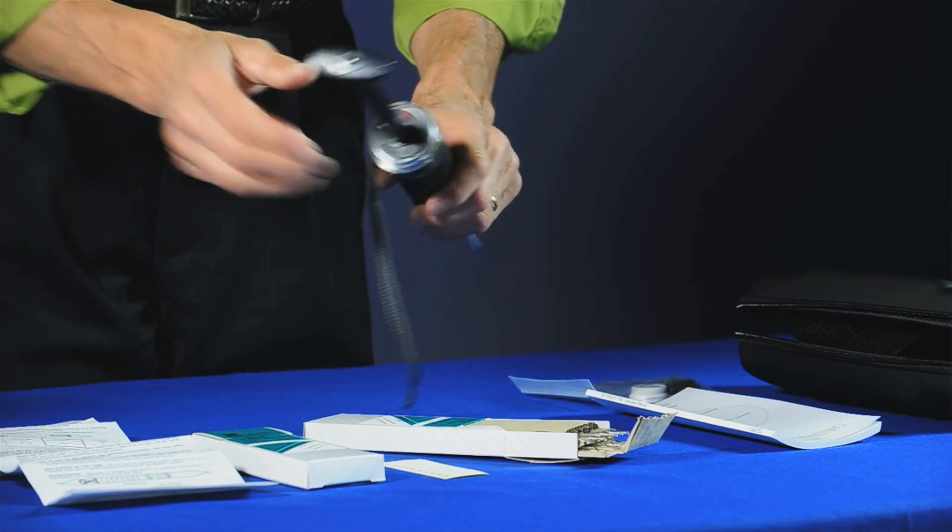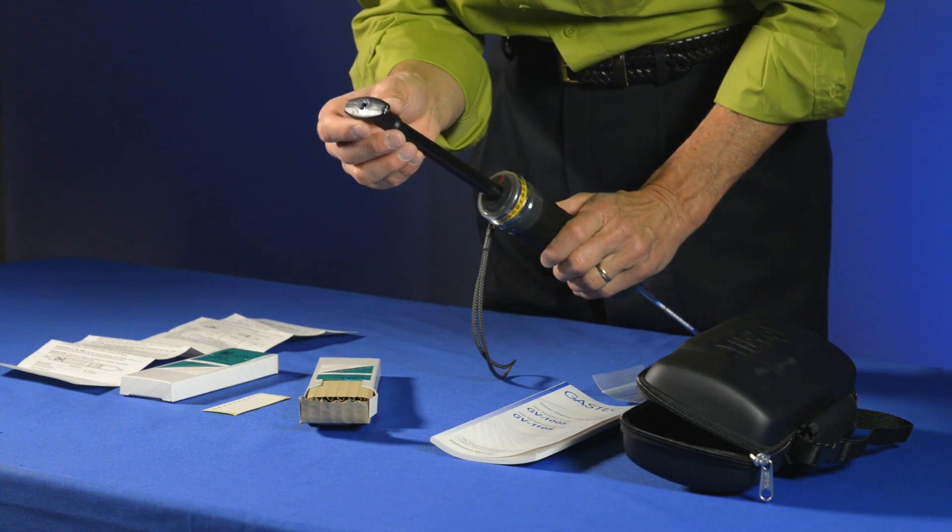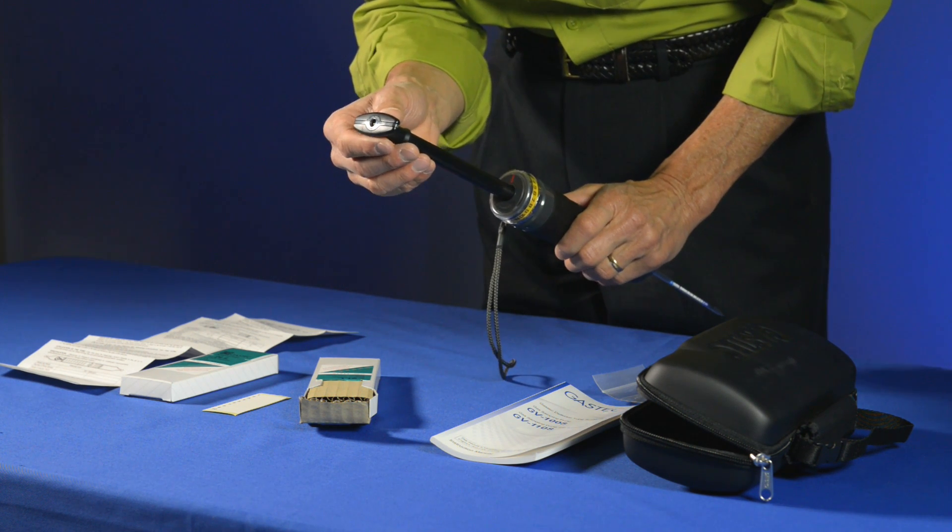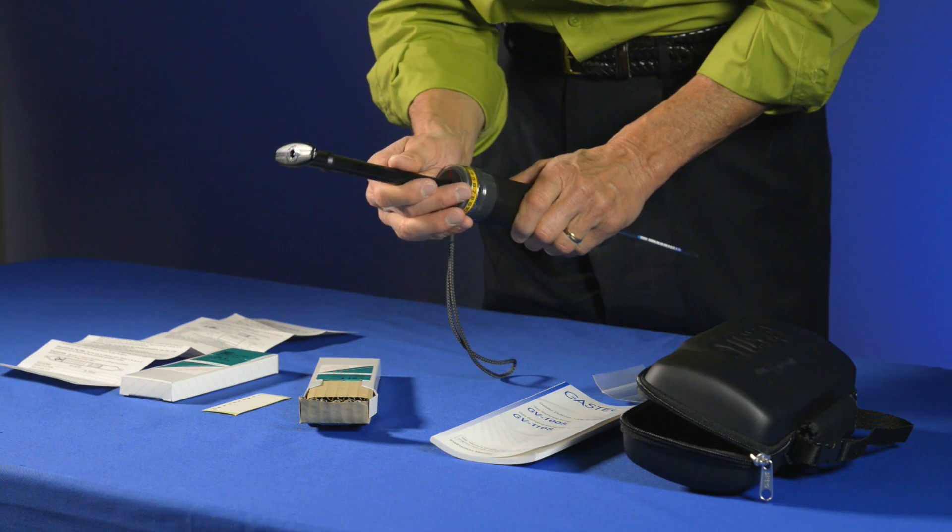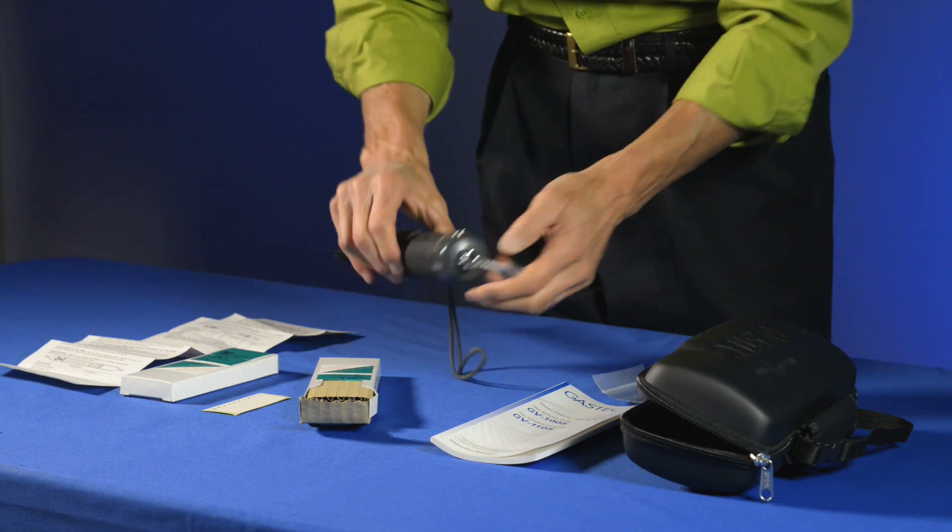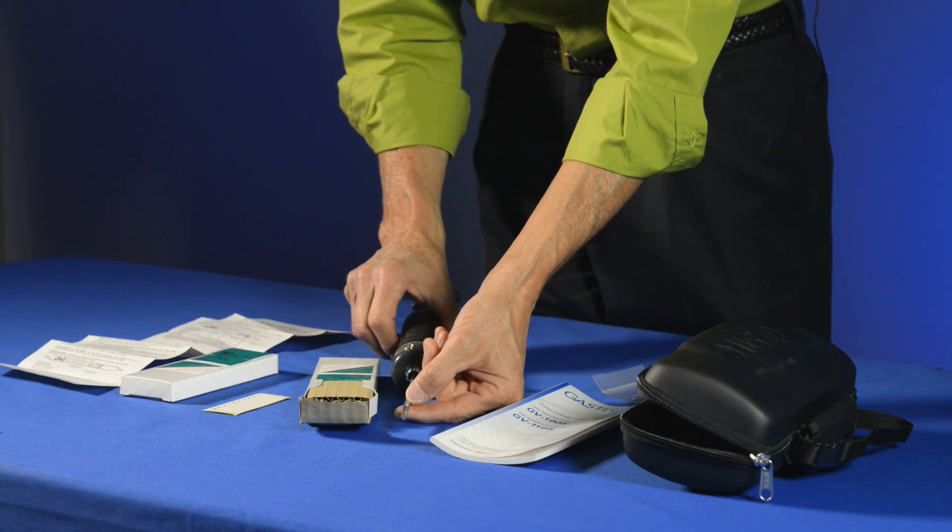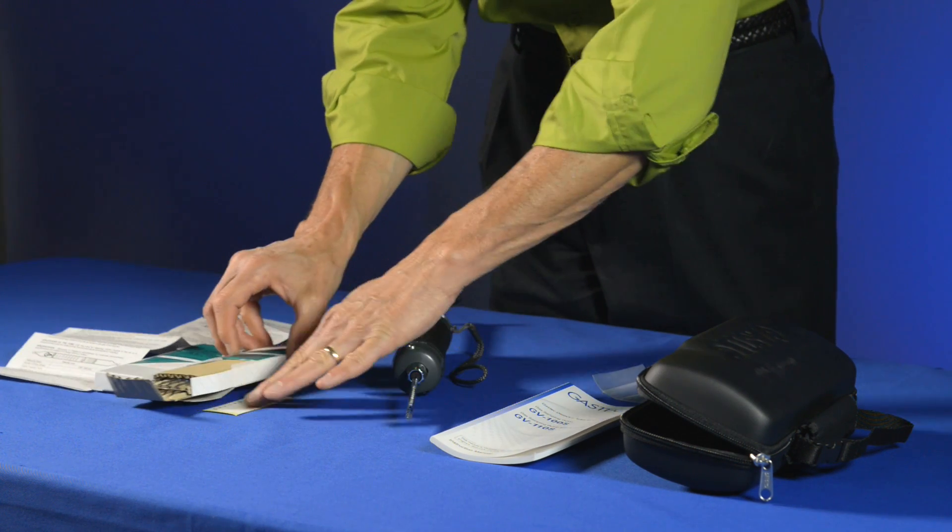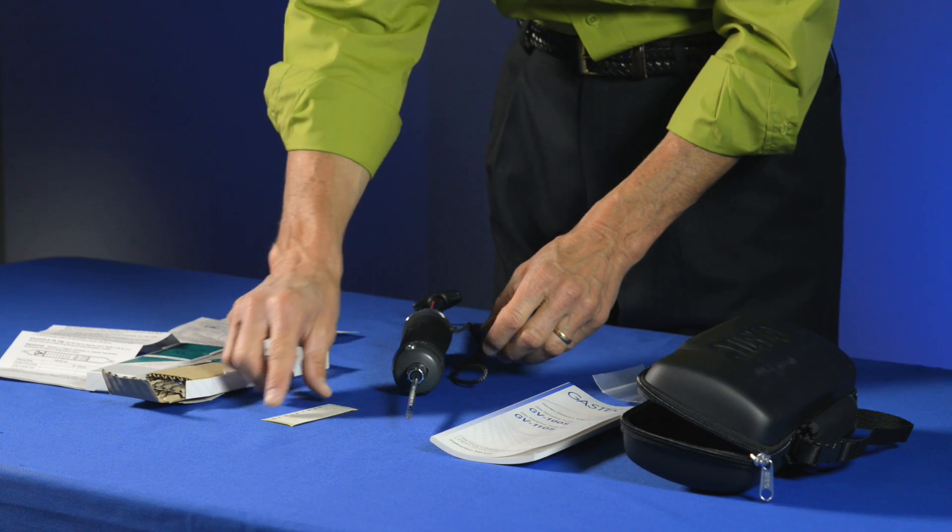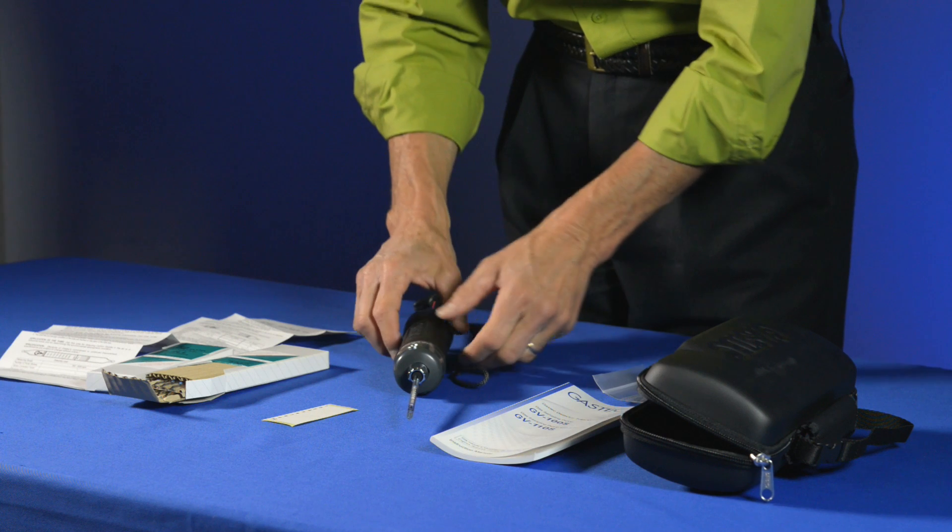So at this point in time, we wait and we look for the flow finish indicator at the back to indicate that the pump stroke is completed. And at the end of one minute, we can take the reading off the detector tube and record it on the small card or sheet of paper here to give us a permanent record.